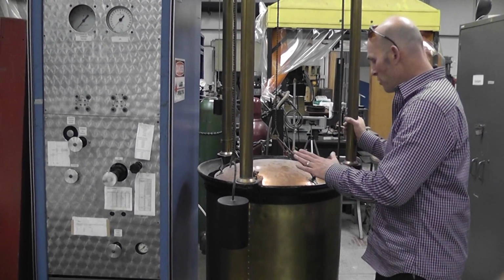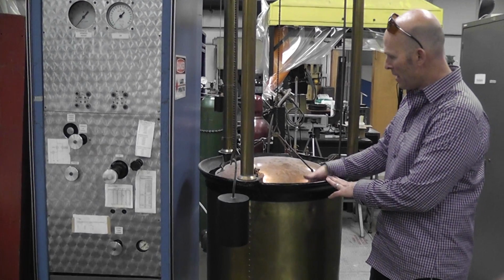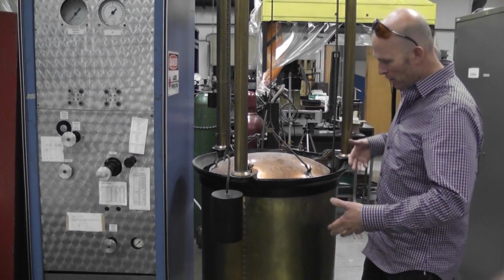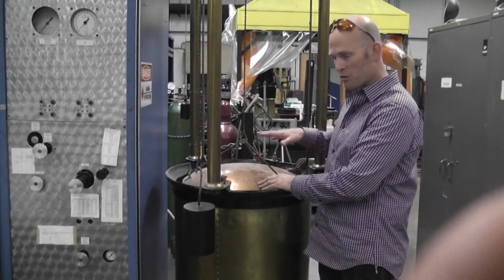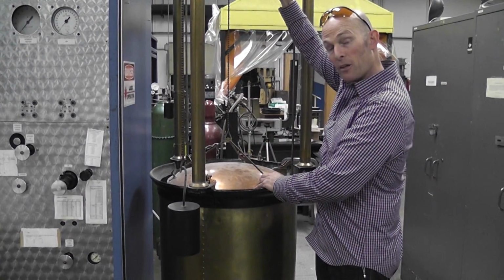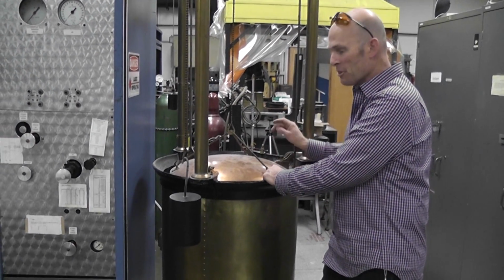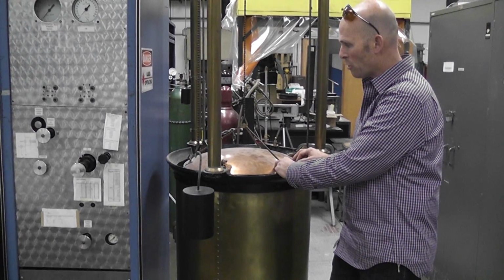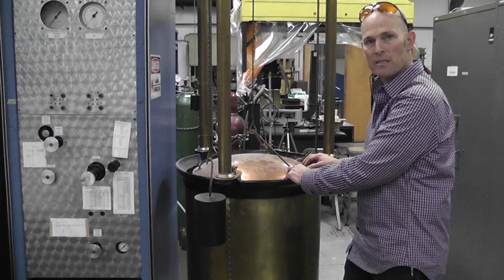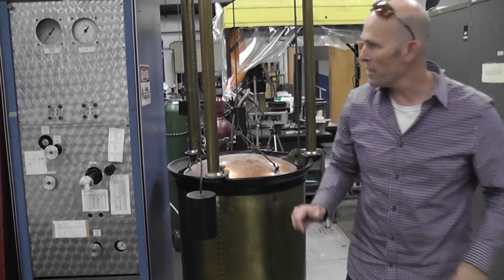So what you do is you fill this with water and then attach a hose to it, and the hose fills an interior chamber with gas, and the rate at which this rises tells you the flow rate of gas that you have going into the chamber. And I actually have used this quite a lot in my experimental work because they're quite good for getting smaller flow rates of gases. Okay, one more thing to show you.